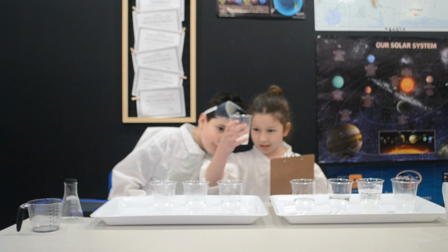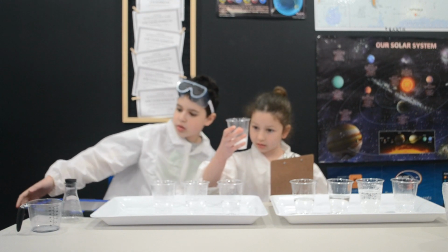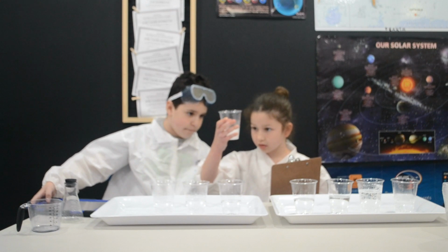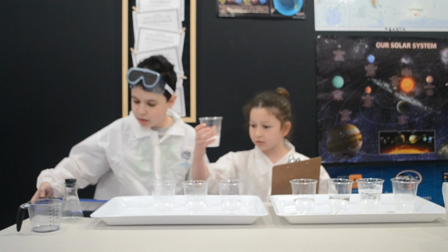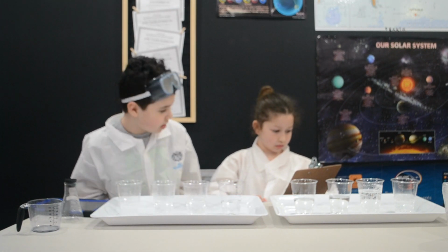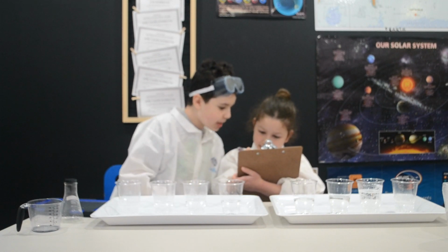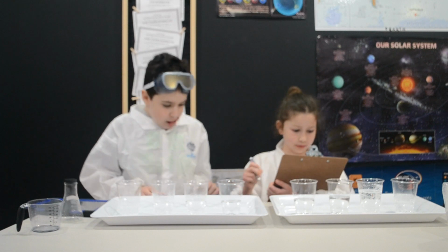There is no vinegar, actually. So we can easily see it the whole time. Get ready. Keep your eye on where your finger's pointing. And it is gone. 56.40 seconds. Whoa, you can even see the newest remnants. They just get super white and then start fading away. So this one, 56.4 seconds.